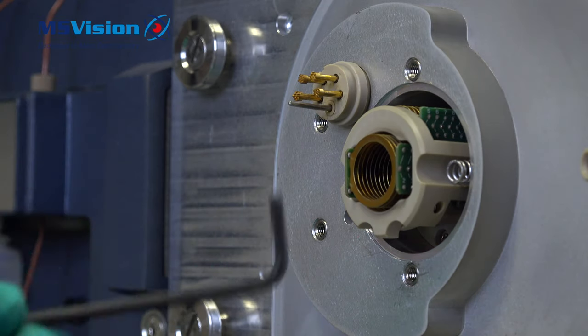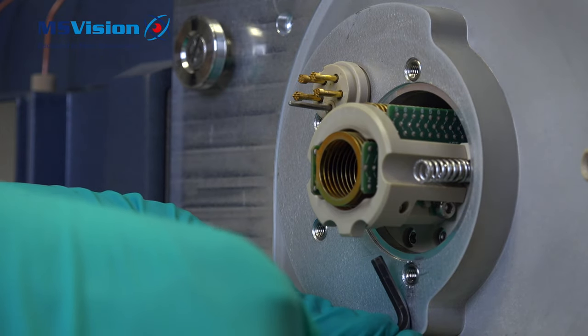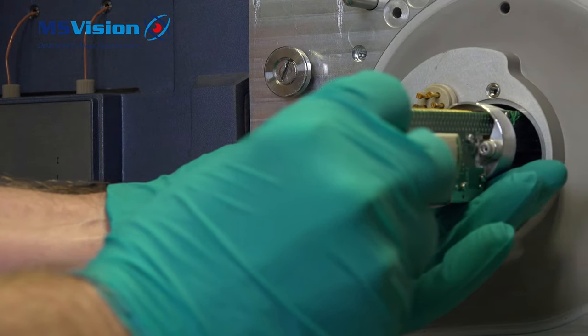There's a special tool for the step wave in order to pull it out, but we can use a regular allen key. Now we can take out the complete step wave.